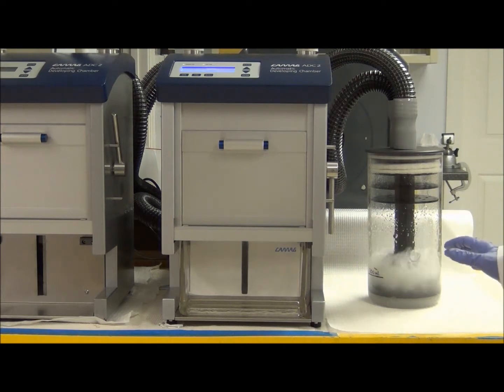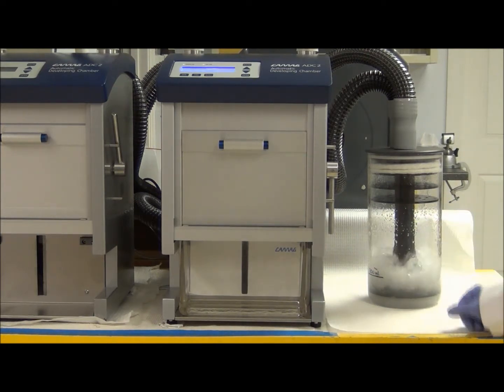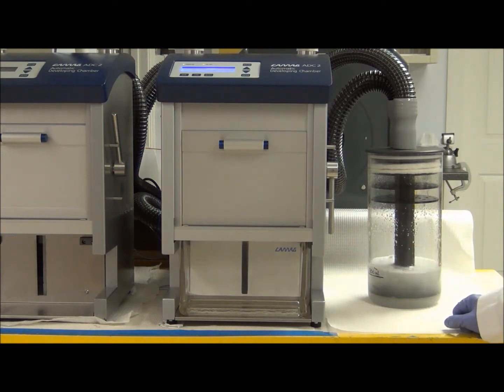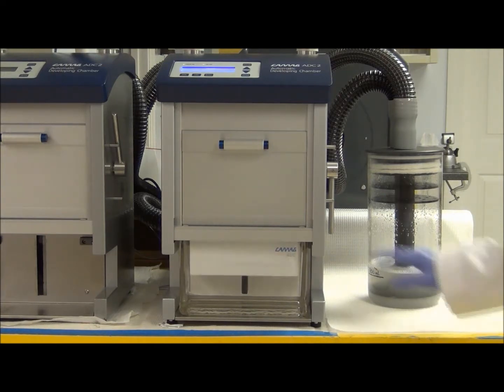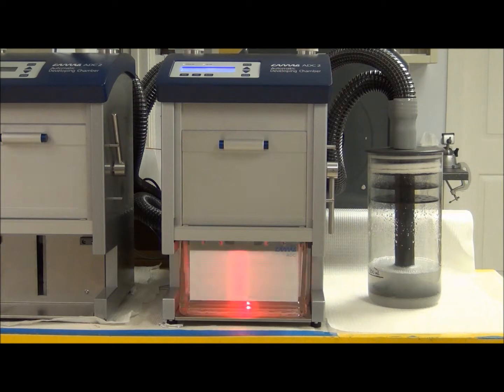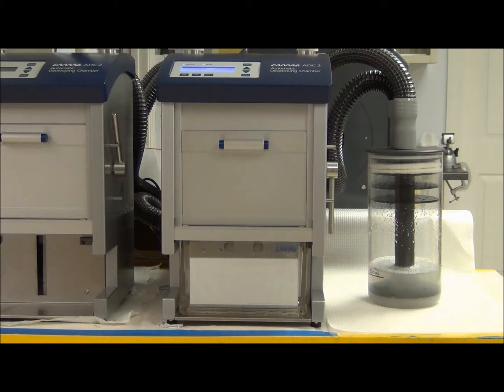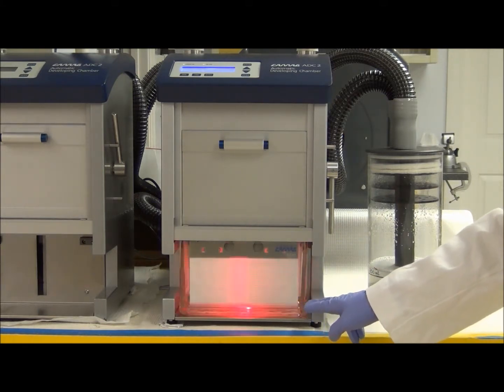The saturation and humidity control are about to complete. You can hear it stops, and now the plate will move down into the chamber — it will be lowered into the solvent, and as you can see, development has begun.